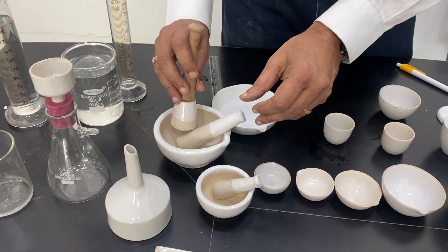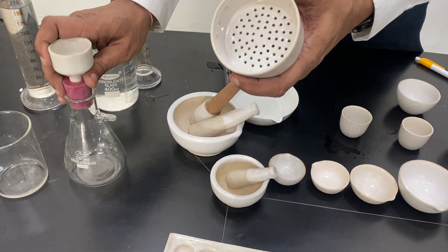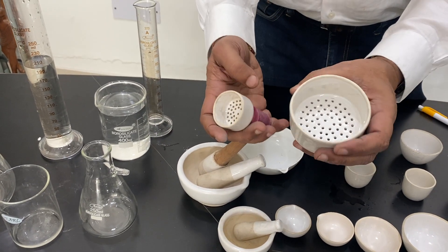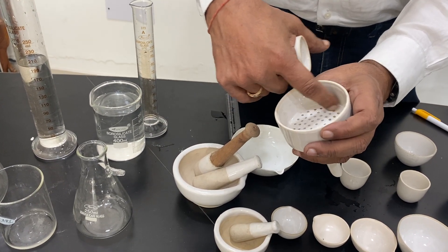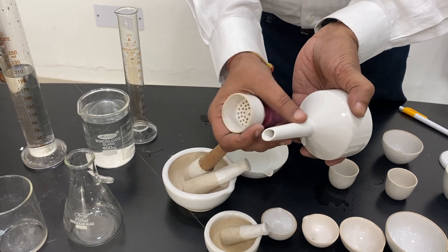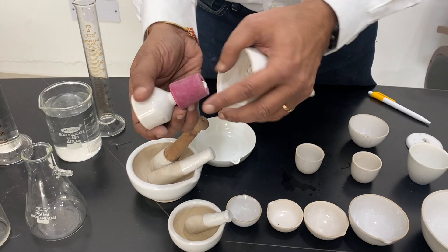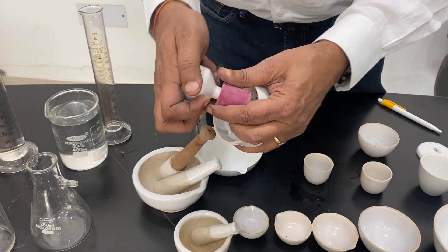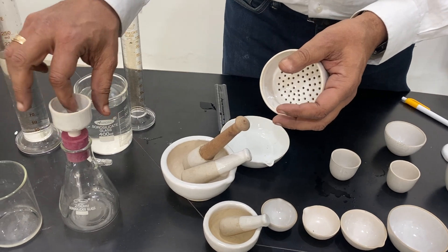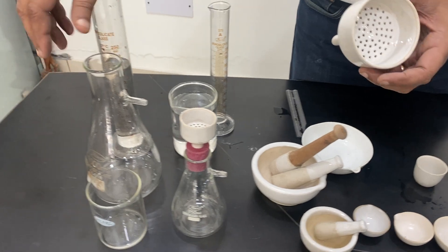One more product is called a Buchner funnel. These come in about 2 inches, 3 inches, and 4 inches. There is a perforated hole and a conical stem. You can put it in a flask, put in filter paper, and then filtration can be done using different filtration processes.